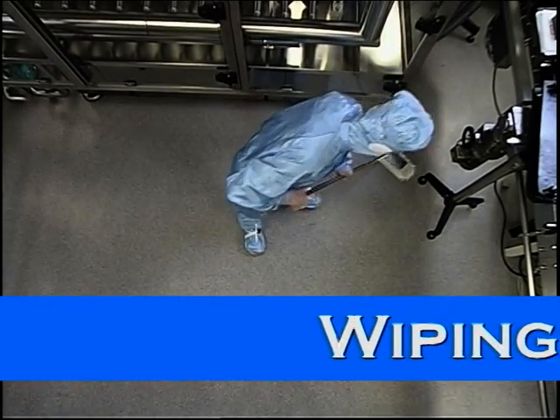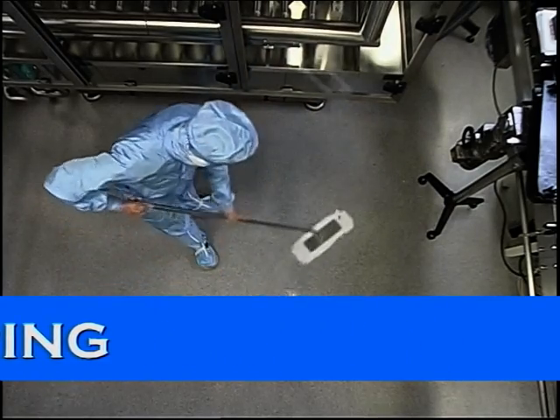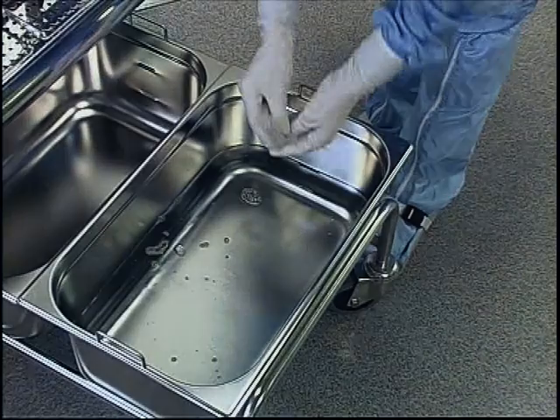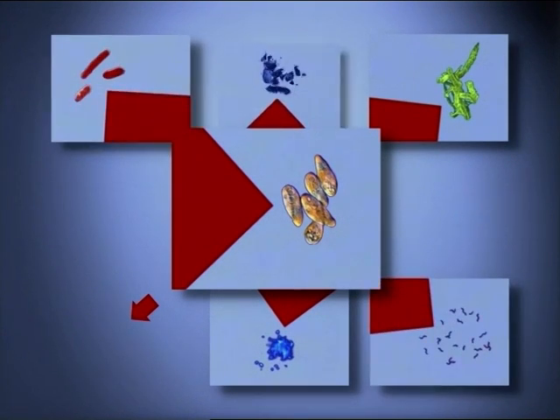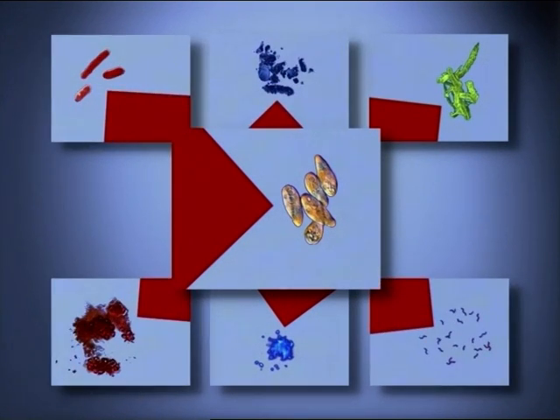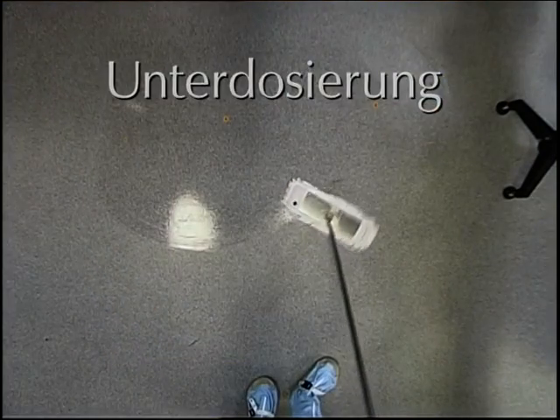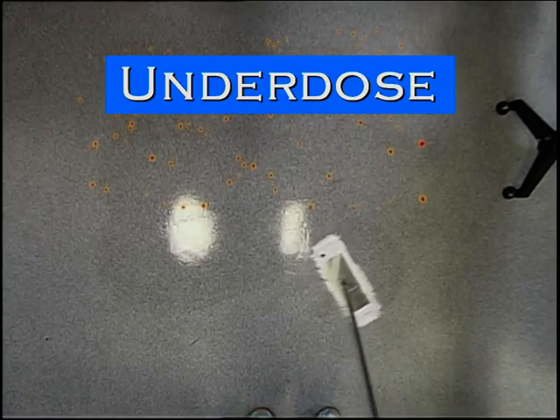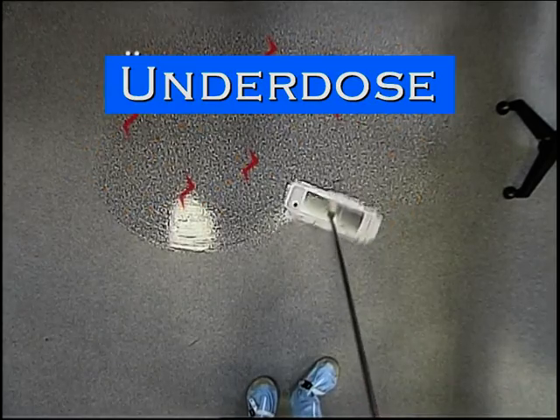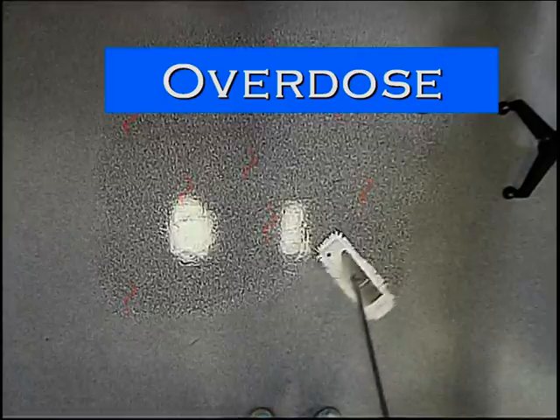Let's turn to the main topic, wiping surfaces. Wiping is done with a mop and a cleaning disinfectant solution. This solution consists of water and a concentrate that must be added at a certain ratio. These so-called concentrations for use are very important for optimal disinfection. If the concentration for use is too weak, less sensitive microorganisms may become re-established. On the other hand, an overdose is uneconomical and may even cause problems for staff and materials.